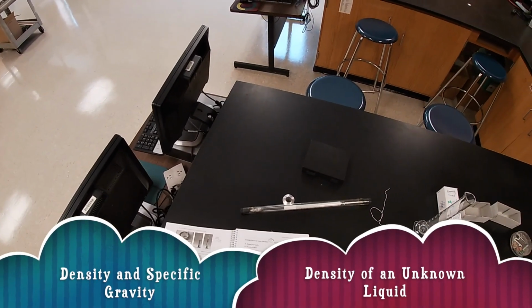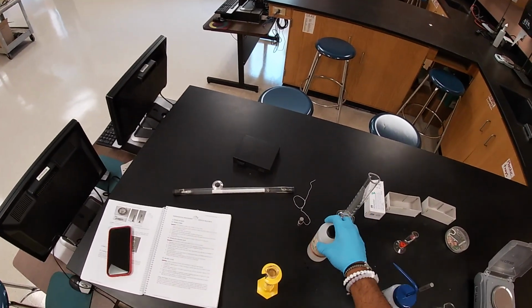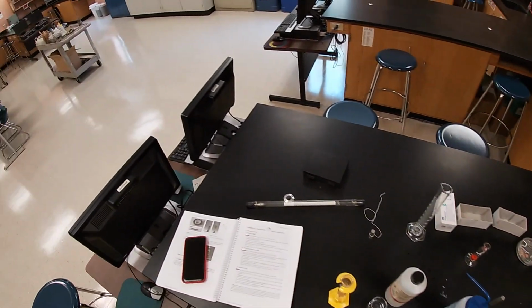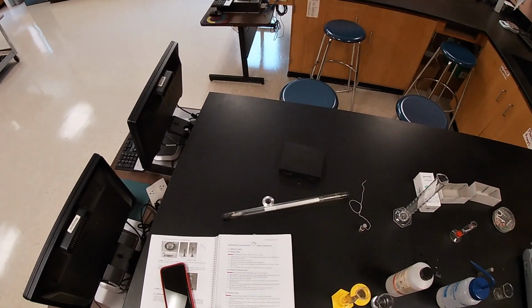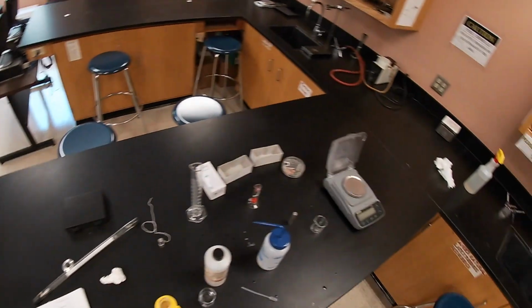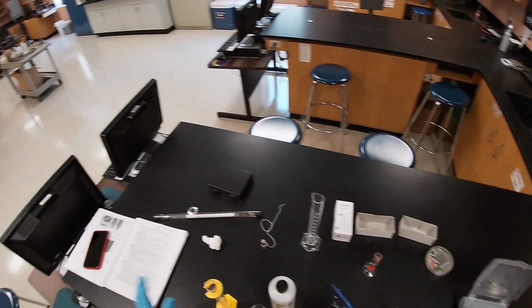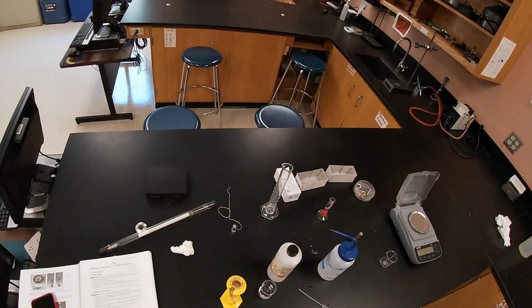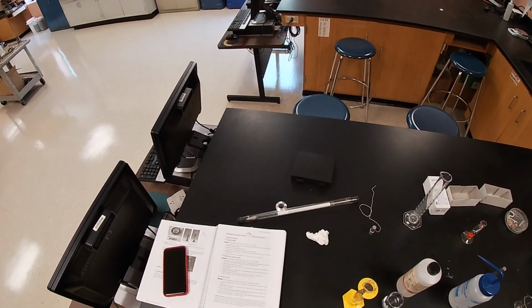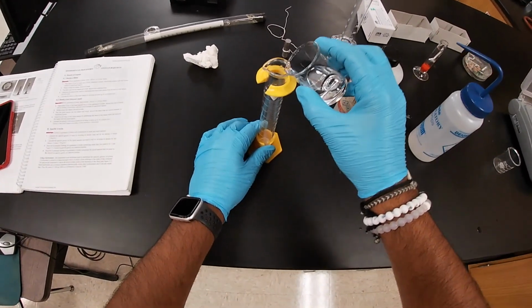Okay, the next thing we're going to do is A2, which is the density of an unknown liquid. Here we have an unknown liquid, which I've already put into our beaker. We're going to place about 20 milliliters of the unknown liquid into the graduated cylinder. Then again, we're going to weigh a small dry beaker and get the mass of it. We're going to do the same process that we just did with the water, and determine and calculate the density of this unknown liquid. Okay, so then we're going to go ahead and pour it in.